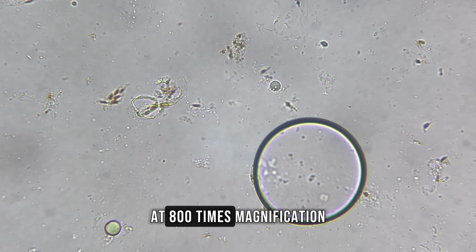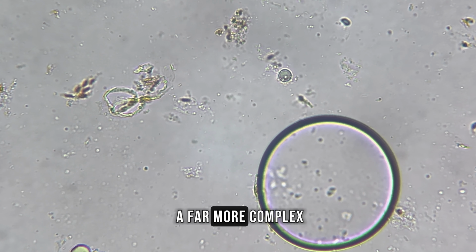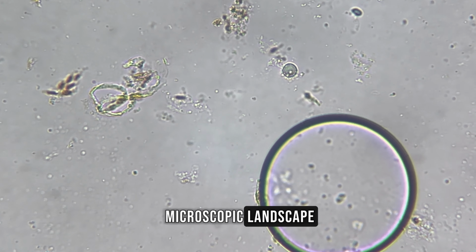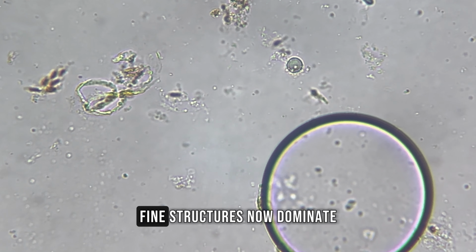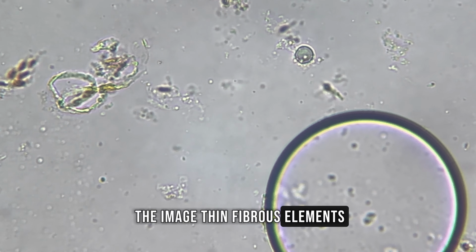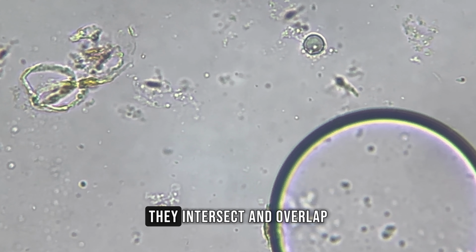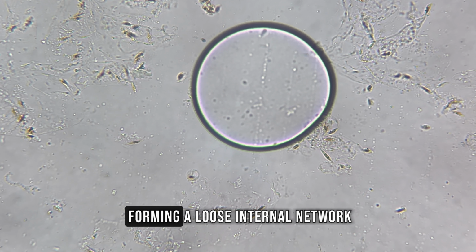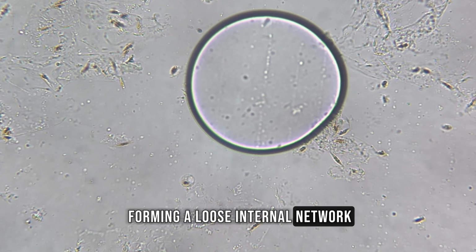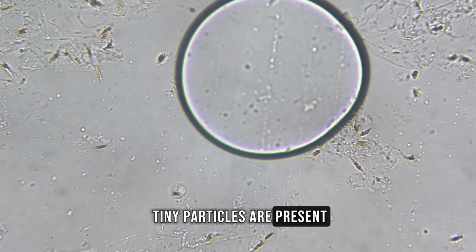At 800 times magnification, the mandarin transforms into a far more complex microscopic landscape. Fine structures now dominate the image. Thin, fibrous elements become visible, stretching across the field of view. They intersect and overlap, forming a loose internal network. Between these fibers, countless tiny particles are present.